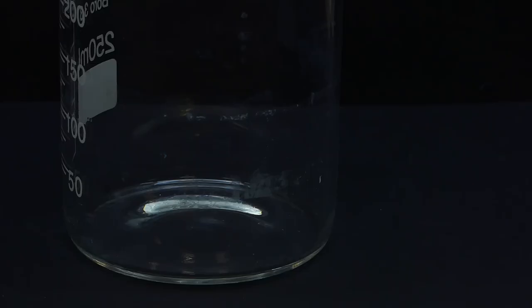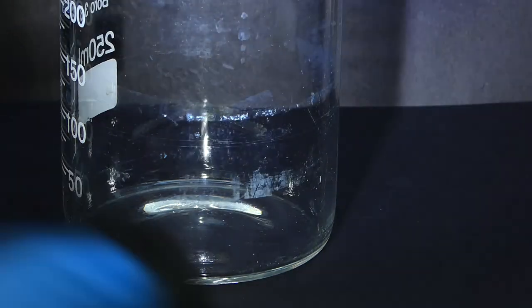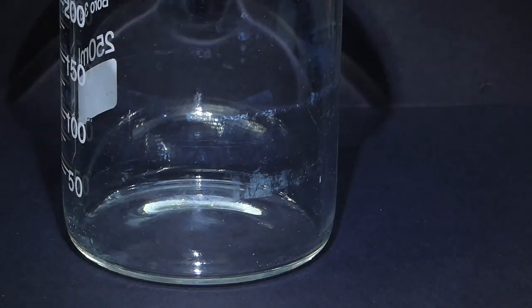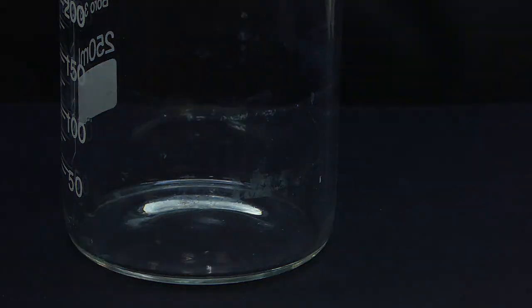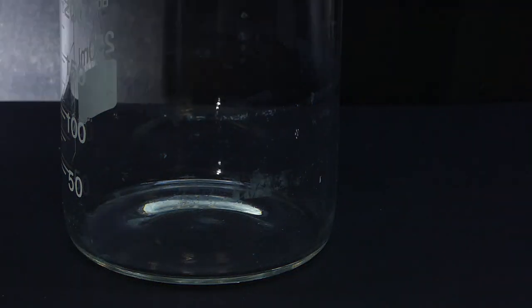On a final note, if somebody has a method of removing copper silicate stains from glassware, please write in the comments because almost all of my beakers are covered in it and after trying to remove it with my whole detergent collection, it is still there.